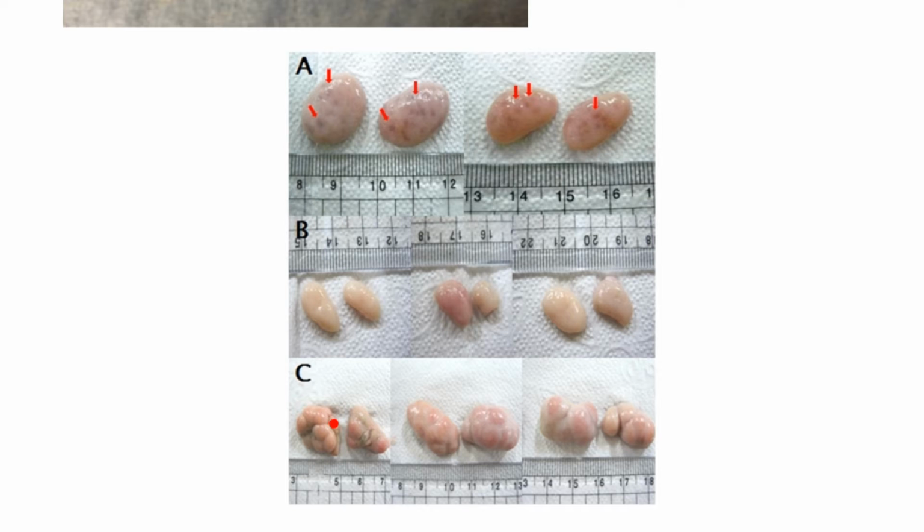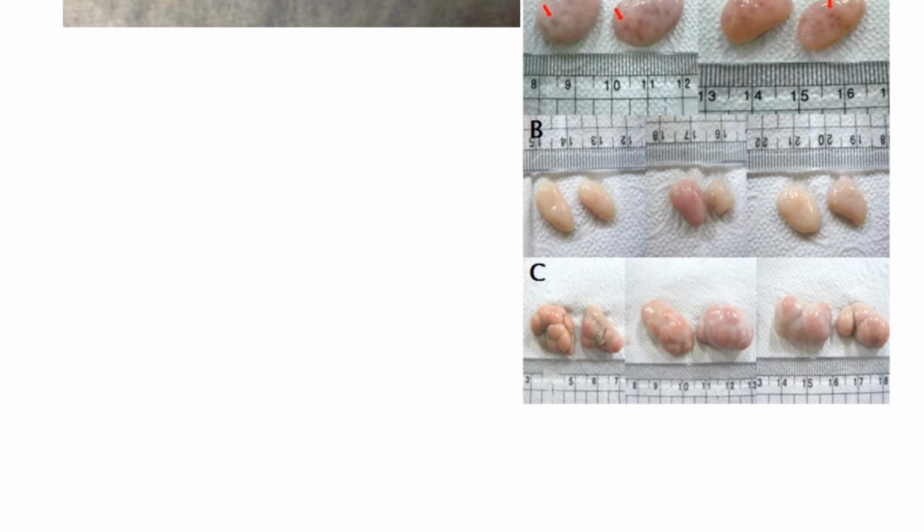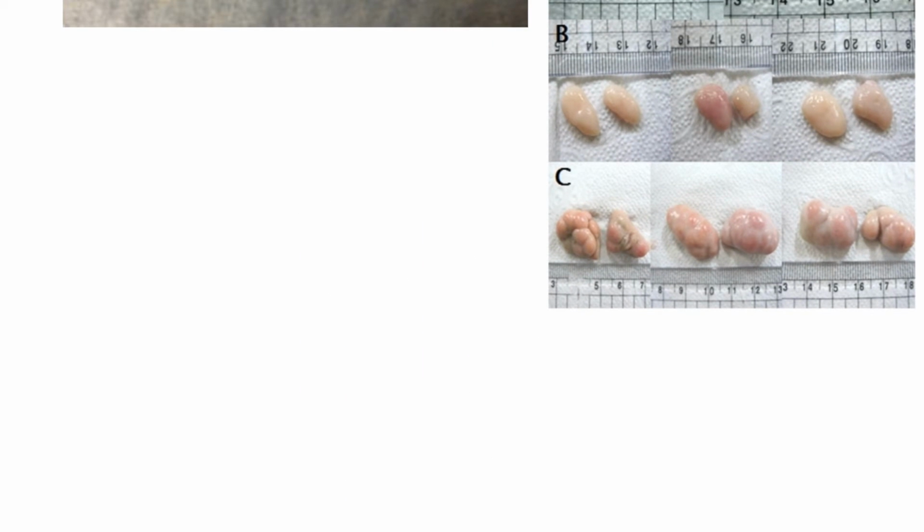And then finally at the bottom, and maybe this one here is the best, is the corpus luteum. Each one is called a corpus luteum, and each one was where a follicle ovulated, and it fills with solid tissue.